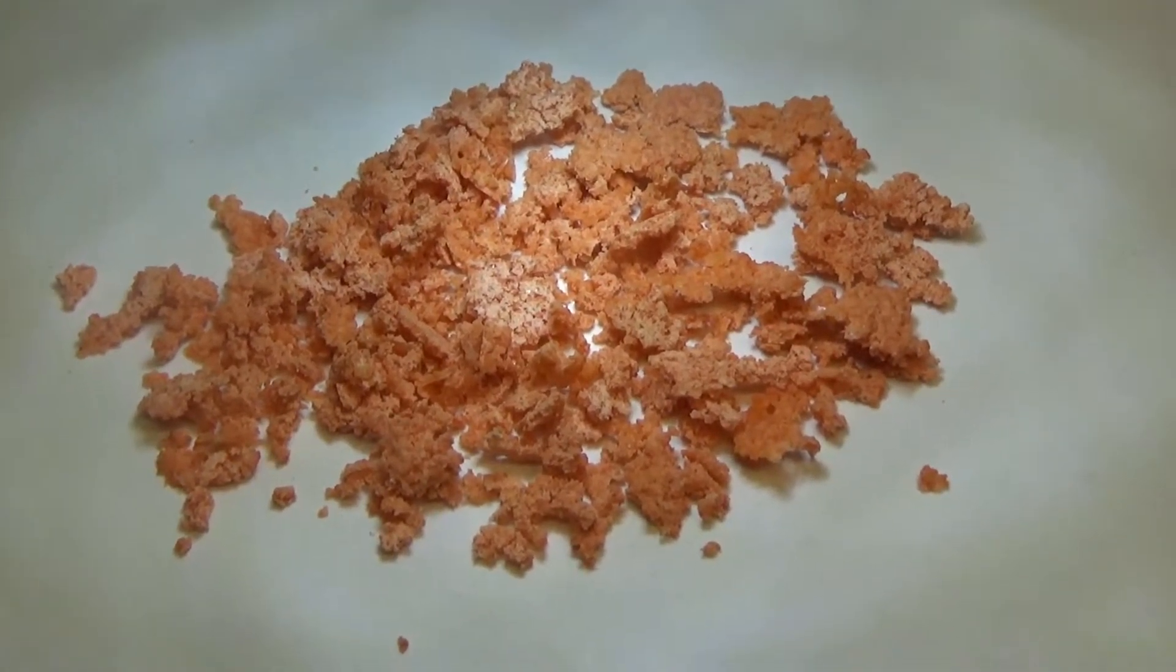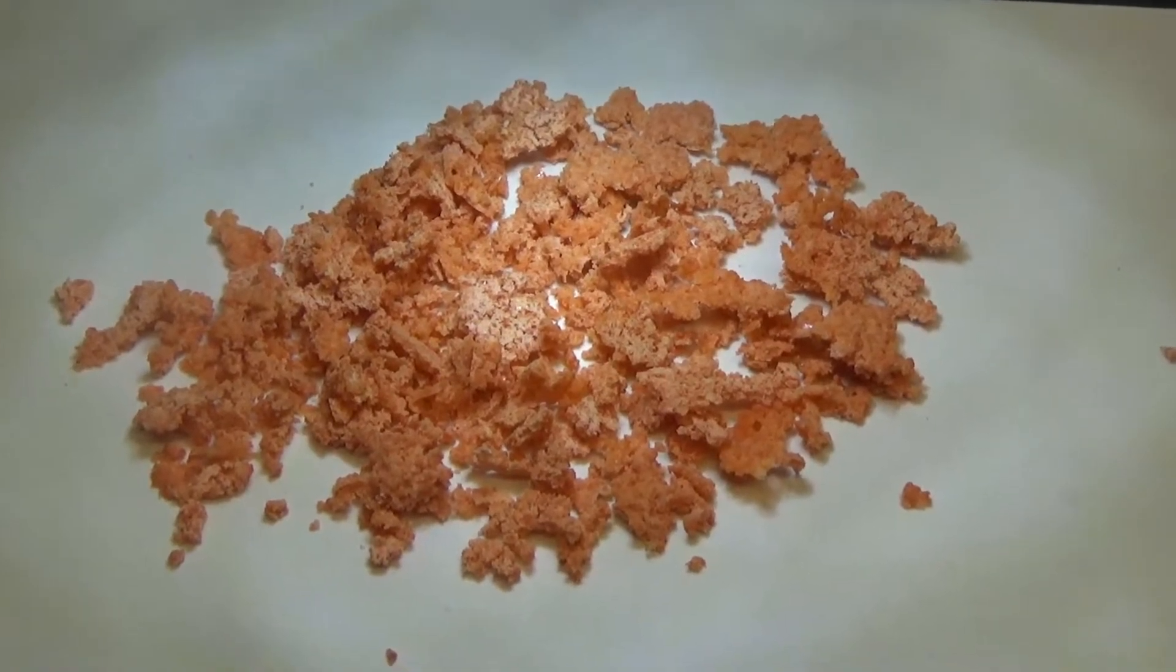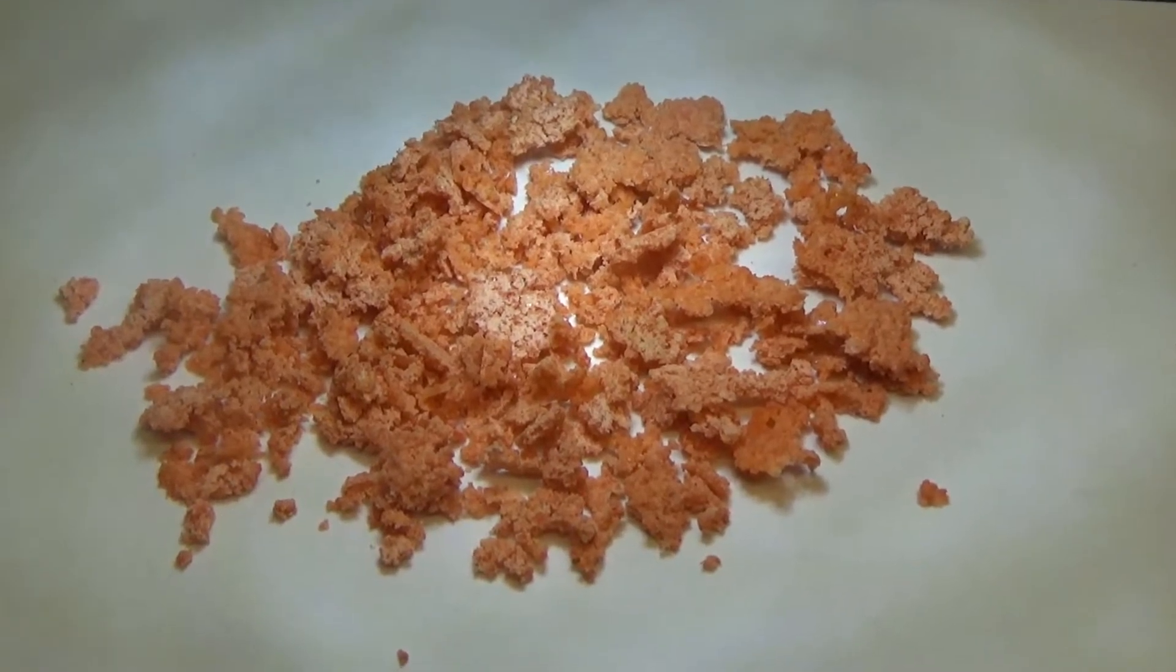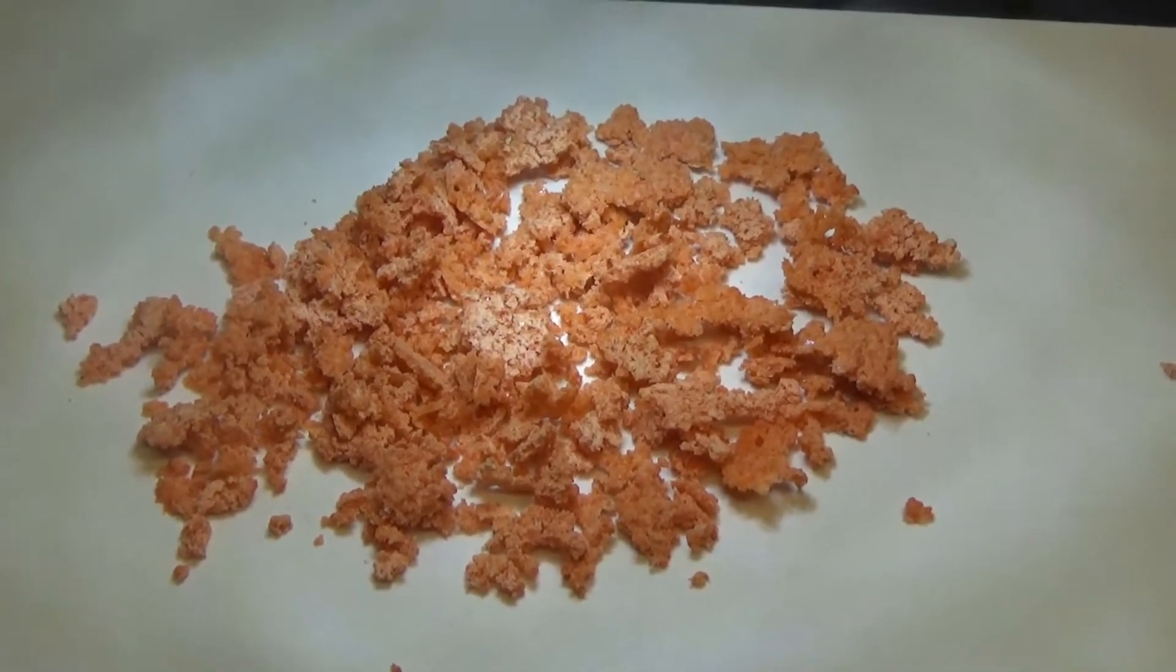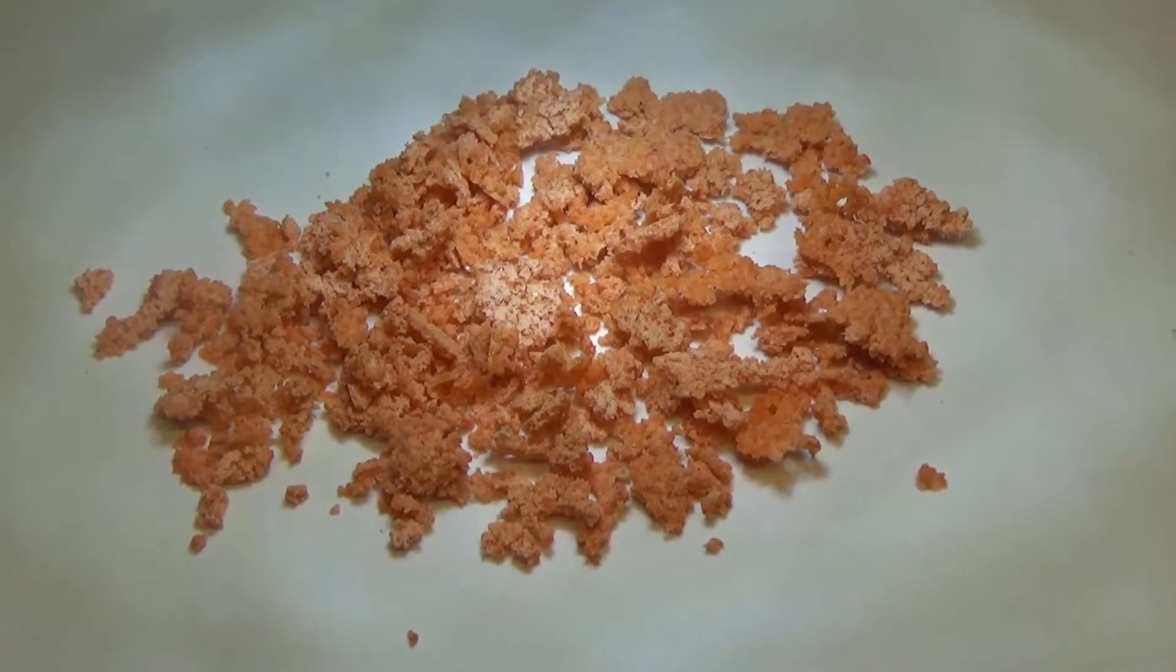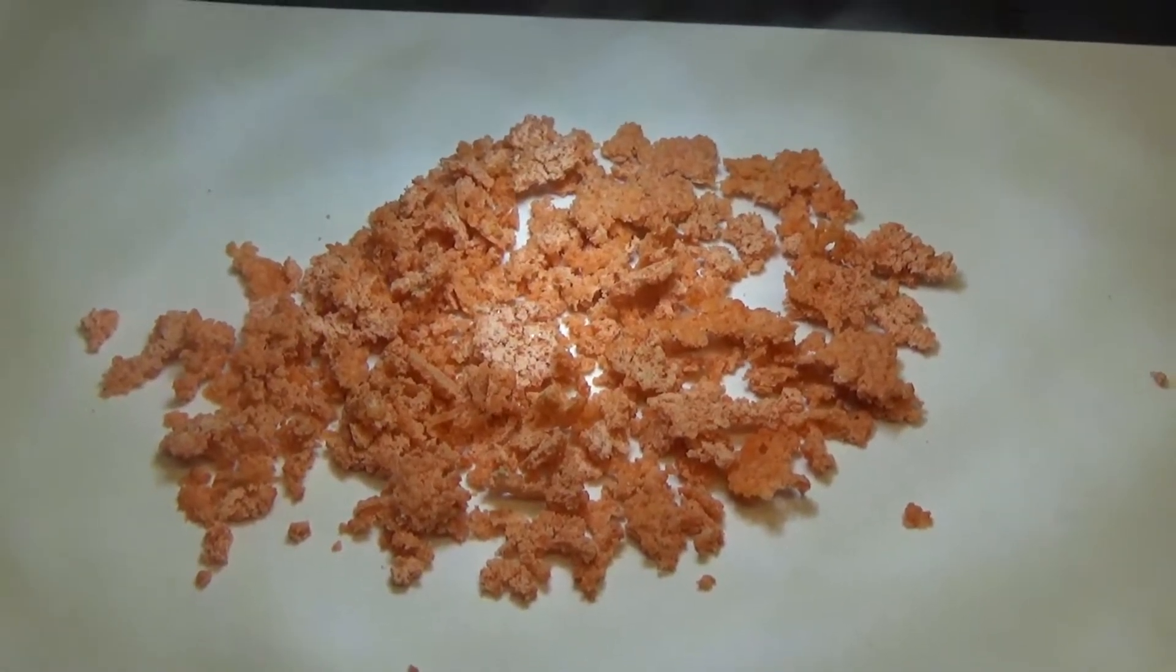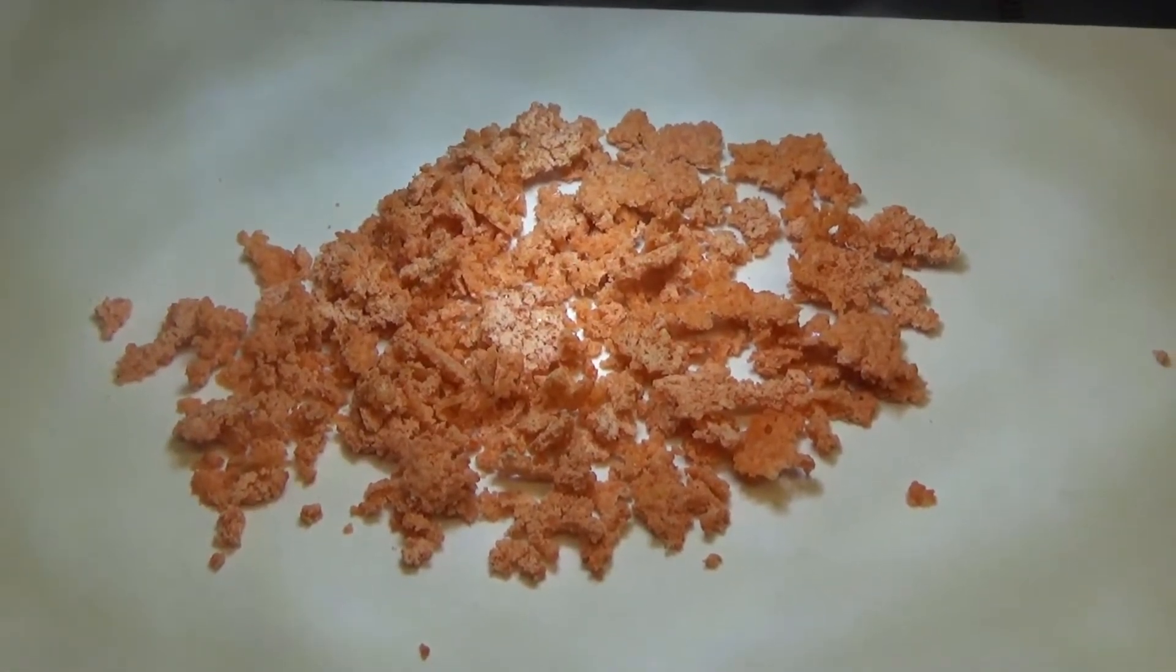So it's an interesting, flaky, crusty thing. From what I understand, the carbonization is supposed to be best when the sodium chloride is mixed best with the carrot powder. And so I'm hoping that this will give the best results because I don't think you can get a better mix. This was from a comment on the videos that someone suggested mixing it with salt water instead of just salt. And I'm liking this result, so we'll see what happens when I carbonize it. Next I'll show you a couple of microscopic views. It really is wonderfully chunky and just an interesting crystalline type of shape where everything is really mixed well. Much better than when it was just a powder mixed with salt.